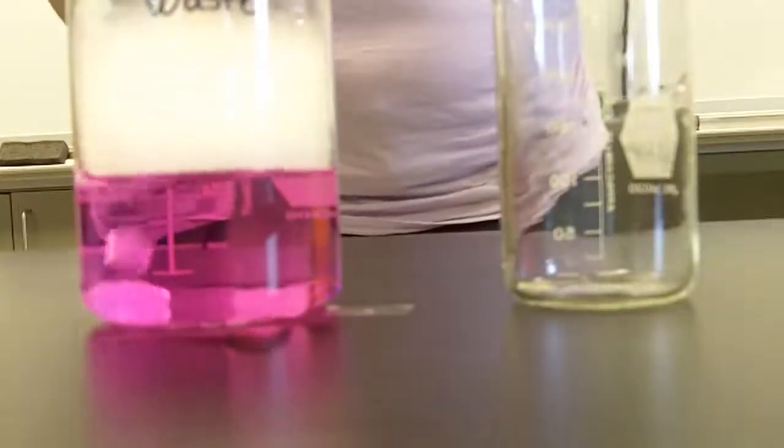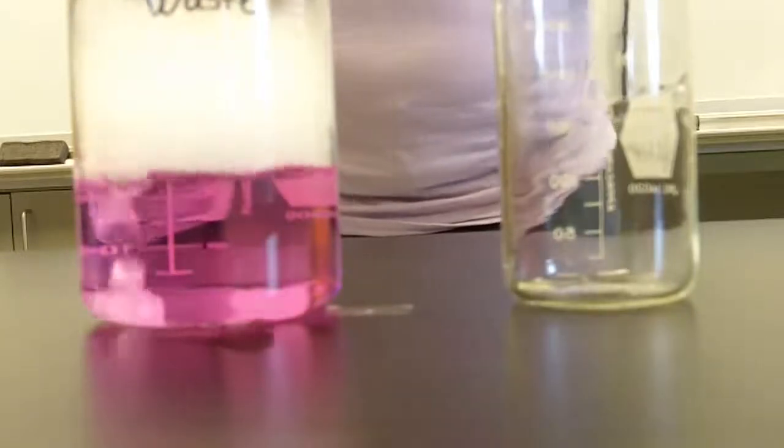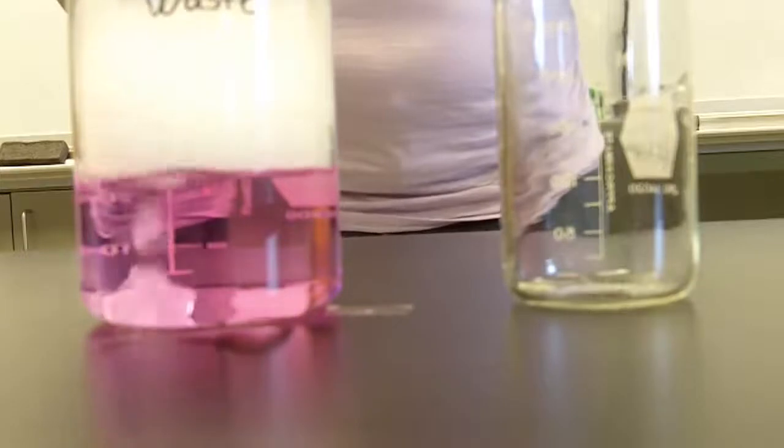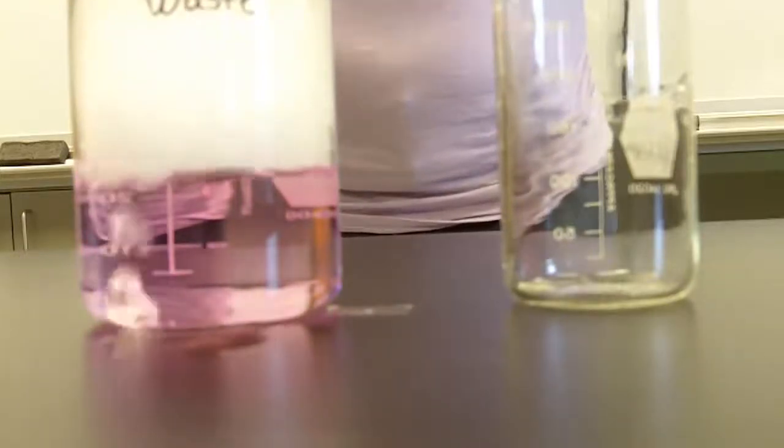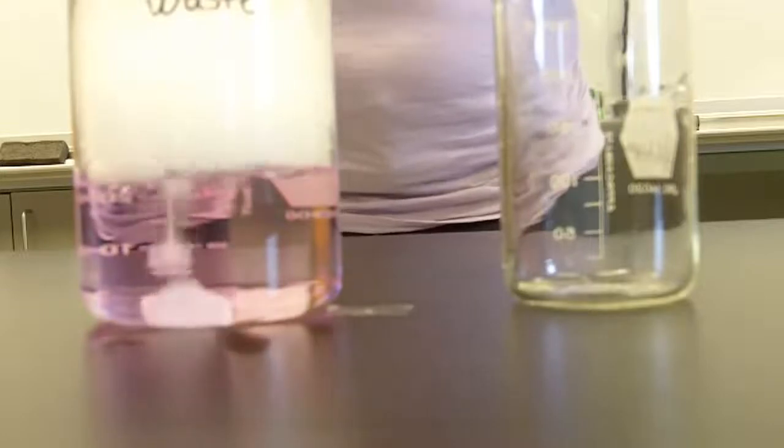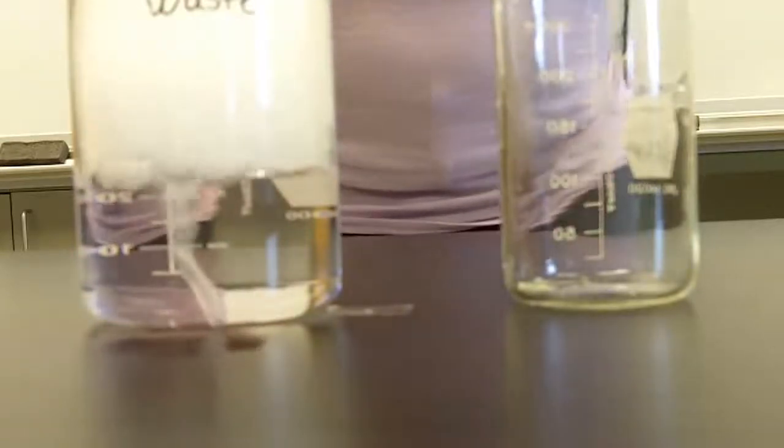So as we can see the reaction taking place of the base with the acid, we have gas that's being released. As this reaction takes place we notice that the pink color is getting lighter and lighter until it turns clear, which indicates that the solution is no longer in that 8 to 12 pH range and the solution has now become more acidic.